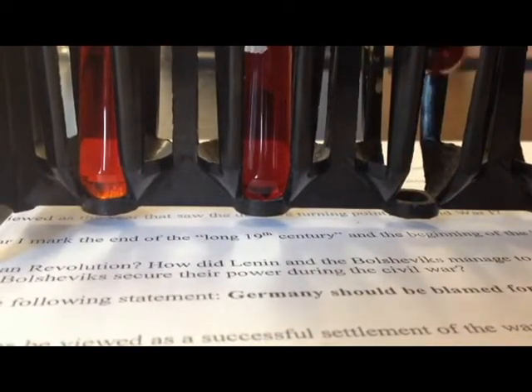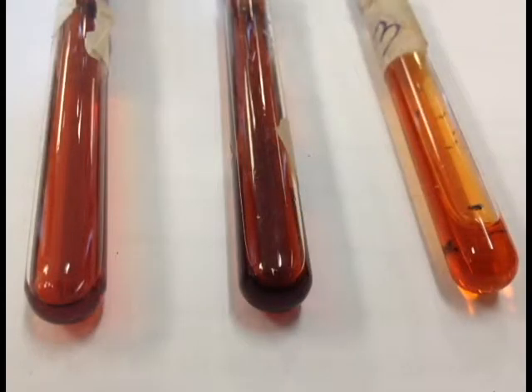In both cases, a color change from red-orange to dark red occurs.